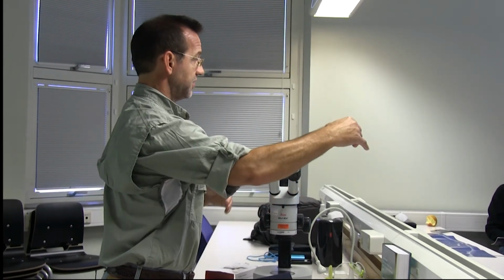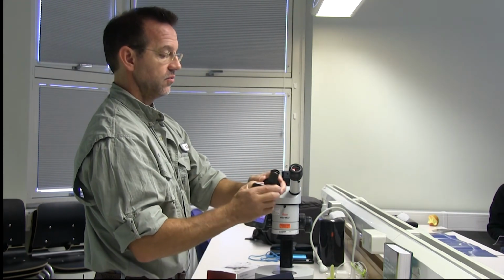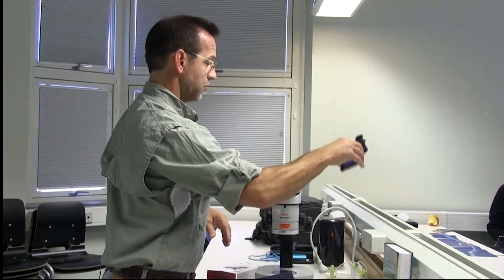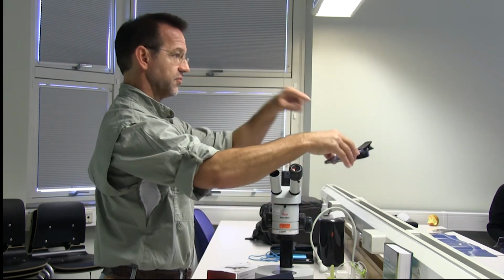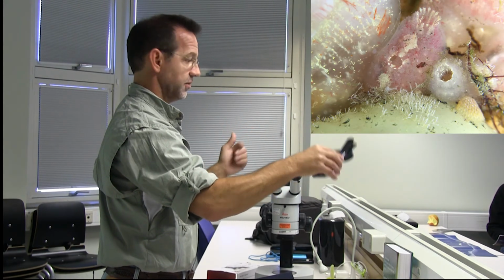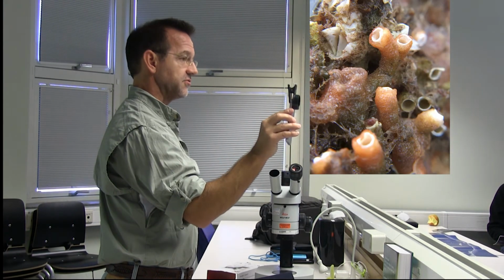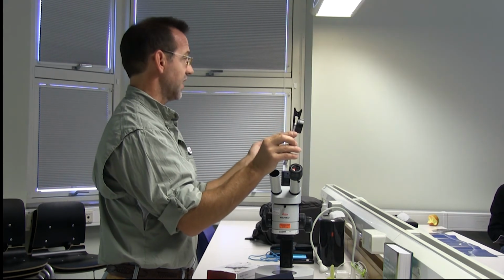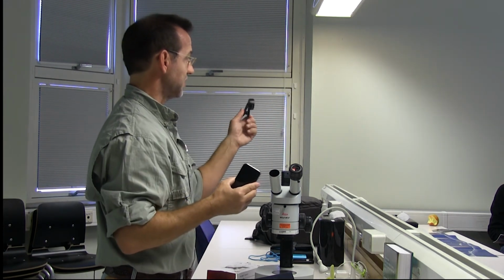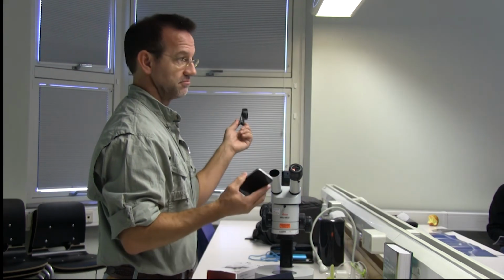So having the wide angle is nice for a picture of the whole disk, and then you easily take off the wide angle lens like that, and you have a macro lens, and then you can quickly get pictures of all different individual organisms that are easily seen with the naked eye. So quickly put it down right next to the sample, maybe within a few centimeters of the sample, and take photographs and video. So this is a really, really good tool, and it's the least expensive one out of all these other ones. So this might be 25 to 30 euros.